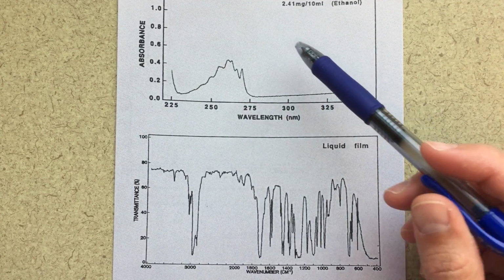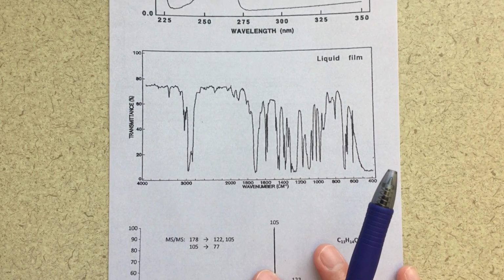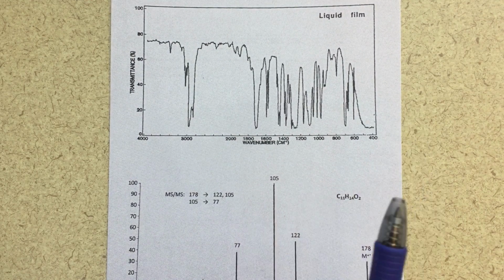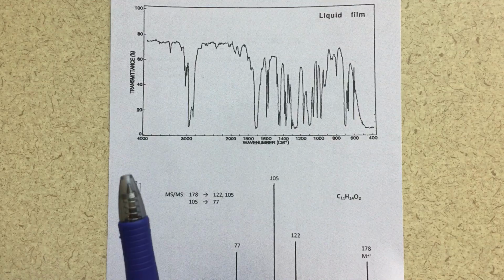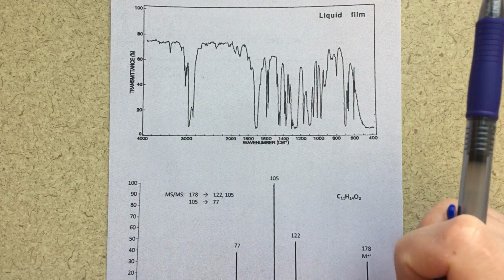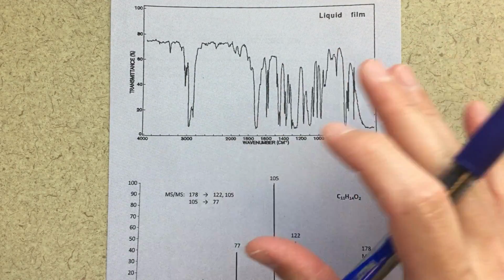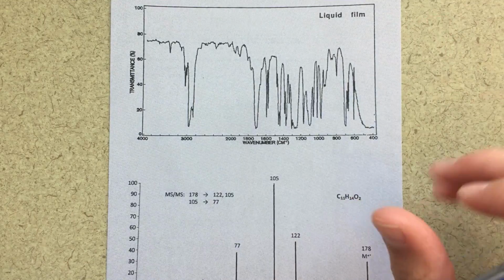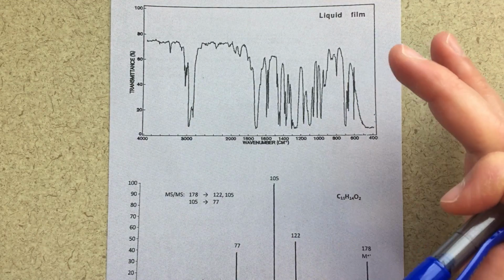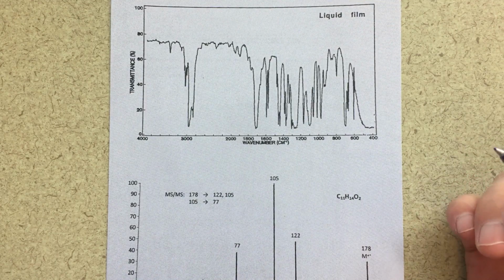The first thing I'm going to do is talk about this UV-vis, and the way that I'm going to talk about it is just by going like this. I don't know that much about UV-vis. I don't find it to be that useful. So if you do find something that's useful in that UV-vis, great. I'm just going to skip right ahead to the IR. I'm not going to skip over everything, but I will talk about all the other spectra that were given. But that UV-vis just to me is not really useful, probably because I don't really know what it says.